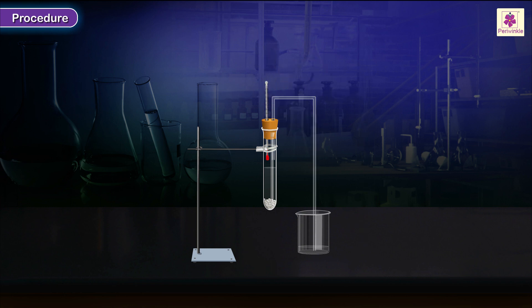Fit the rubber stopper at the mouth of the test tube so that the mercury bulb and the end of the delivery tube lie clearly above the water level in the test tube.